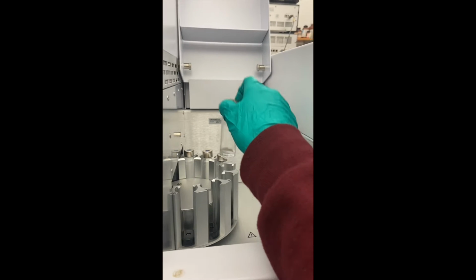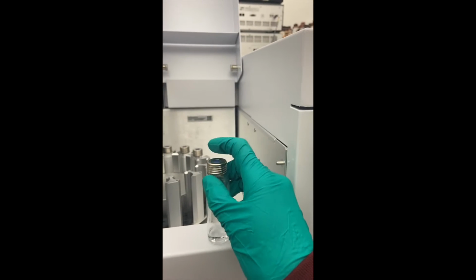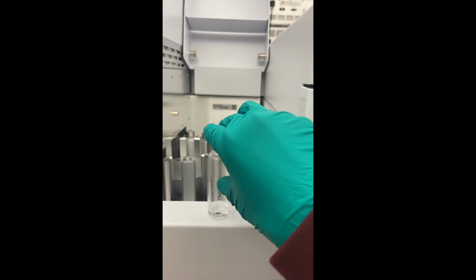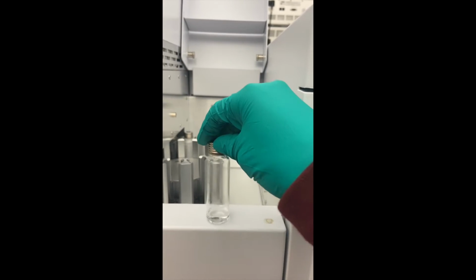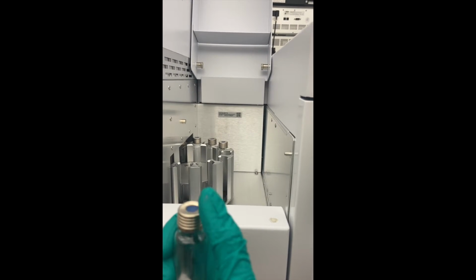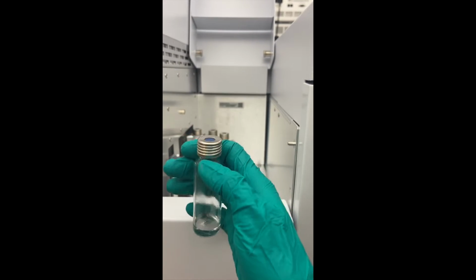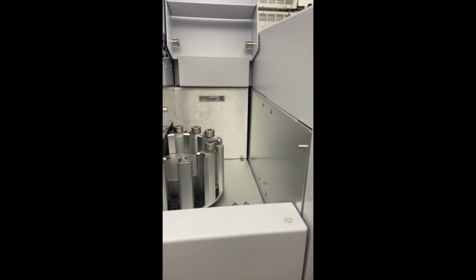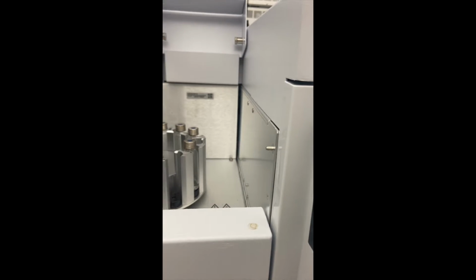Okay, so one thing to note whenever you guys are prepping samples: these are headspace vials. For this instrument, you never want to fill it up more than 50% of the vial. And whenever you are ready to run, you always want to make sure that the inside of your cap is actually dry. The way the headspace works, it doesn't work well if it's wet. So you just want to be careful with that, okay? You don't want it to be wet from the inside, on the top of the cap.